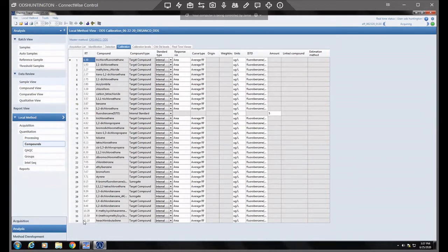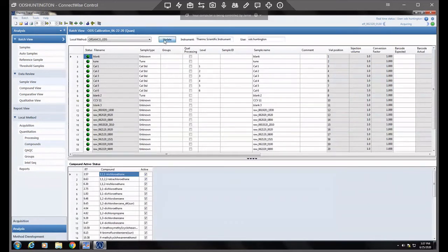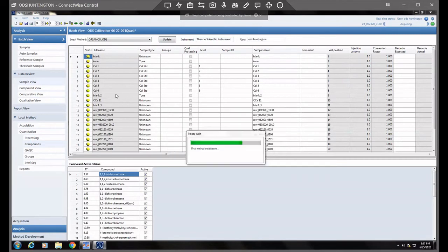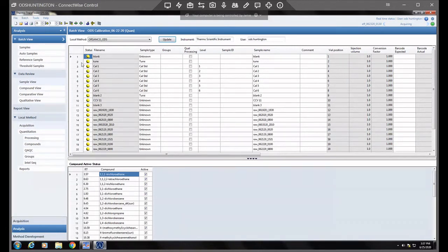If you can see, the hexachlorobutadiene does not have that updated time, because we haven't updated that local method yet. So go back to batch view, and if you click update, it'll ask you, this will update the local method and clear the batch results, so do you want to proceed? Well, yes, we do. It's going to turn these all yellow, and then we have to resubmit the batch. That doesn't mean we have to recollect the data, because the data is there.